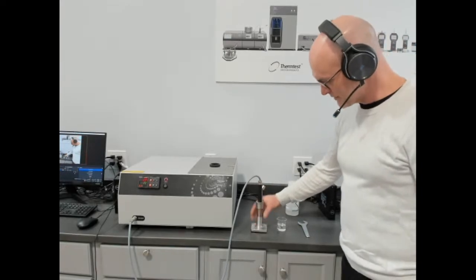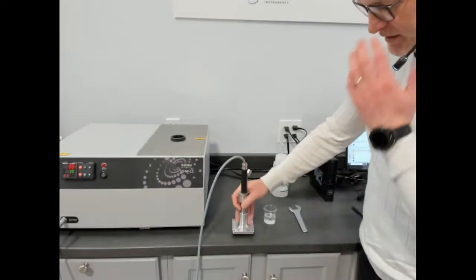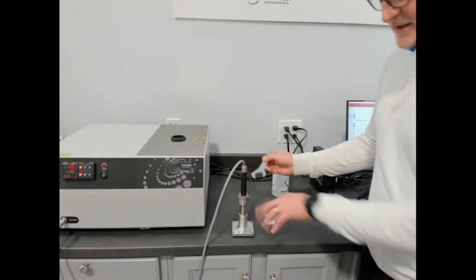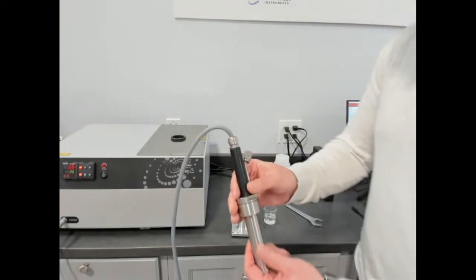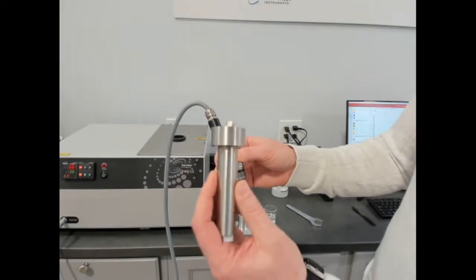This is our room temperature stand. This actually has a hexagonal shape to the bottom that allows us to position it on the bench and unlock it, or unscrew it, loosen it. You can do that with a wrench. It's not tight right now because we don't have a sample loaded, but I can pull it out. We're going to just show you what it looks like. So this is our liquid cell. This is common stainless steel. We have, again, different accessory versions of our cell.